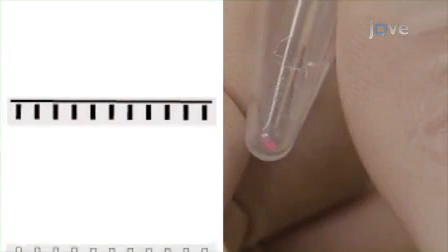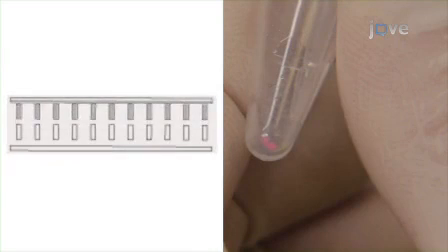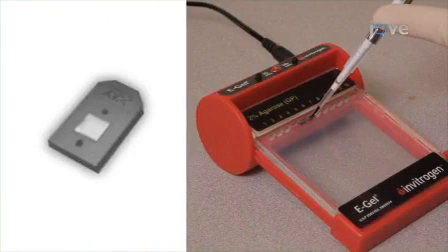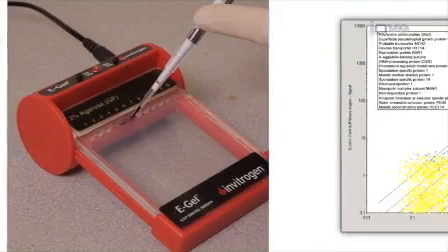The second step of the procedure is to generate and purify cDNA from these RNA samples. The cDNA is then used to prepare biotin-labeled cRNA via in vitro transcription. The final step of the procedure is fragmentation of the biotin-labeled cRNAs for hybridization to the Affymetrix yeast gene chips.